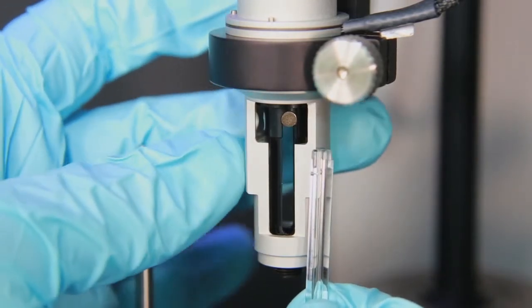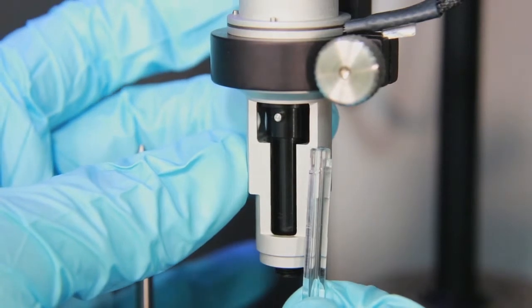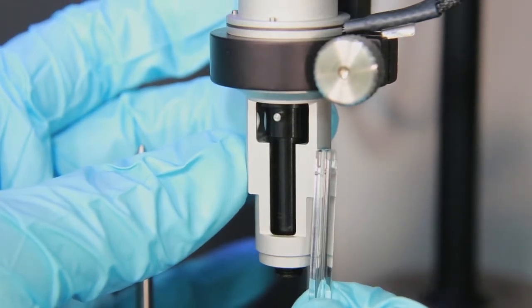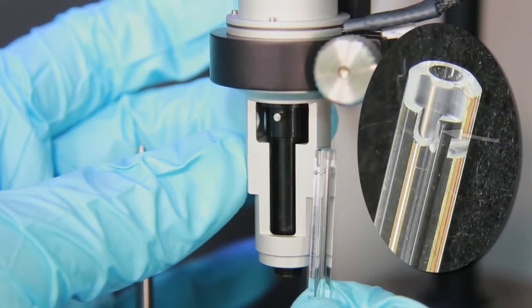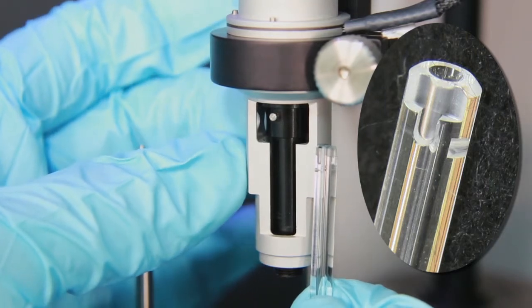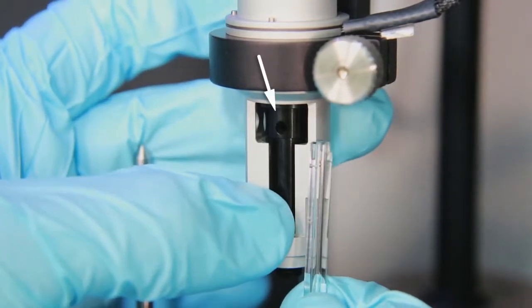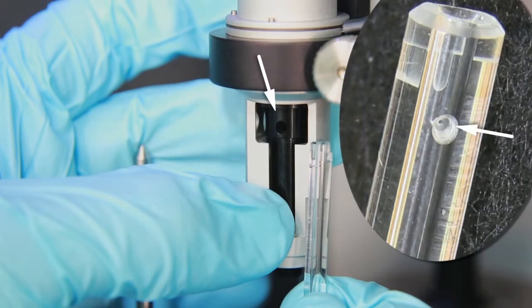For example, this pin in the pipette notches into the key you can see machined into the glass. I prefer to align the fill port hole in the pipette to the hole drilled into the glass.